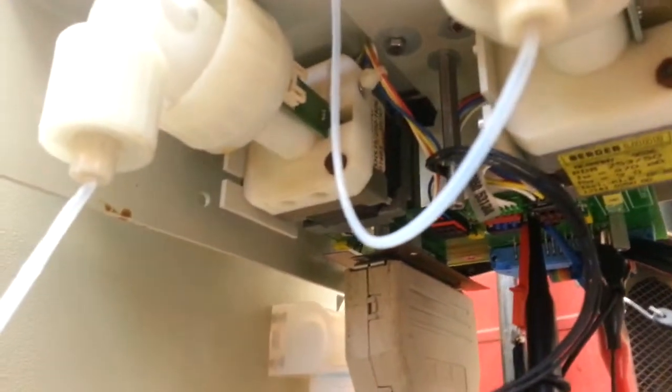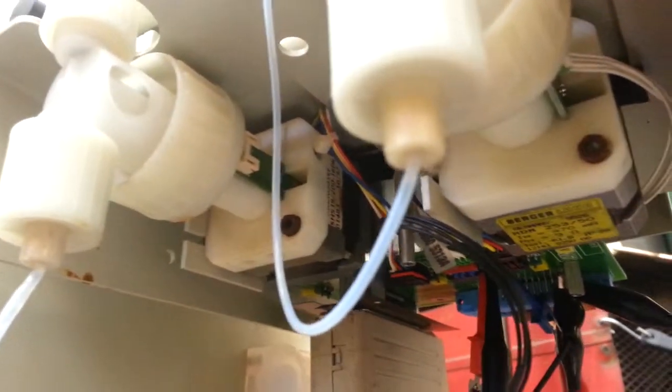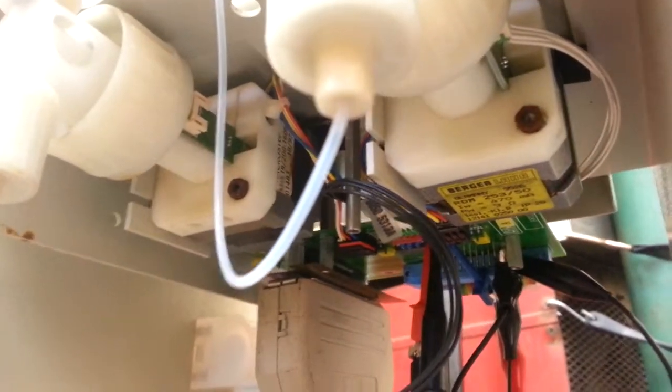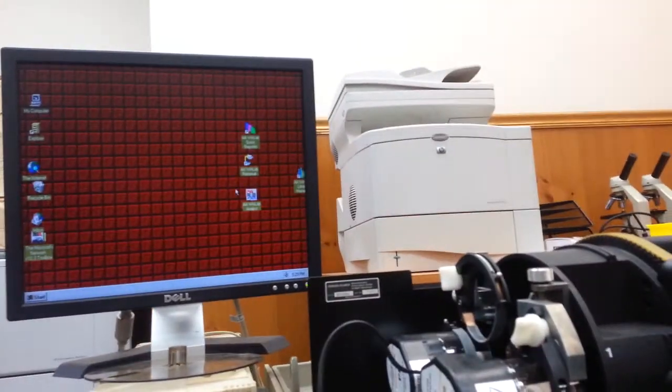Anyway, so it tries to move that motor all the way to one end or the other, and what I've noticed is that if I unplug the Hall effect sensor and trigger it manually, the motor stops prematurely and starts going the other way. So clearly, what's going on here is we're not getting the signal out of that sensor, and whether that's because something is not actually engaging the Hall effect sensor, or because there's an issue with the Hall effect sensor is not immediately clear yet. But I'm going to fire up the software here real quick.